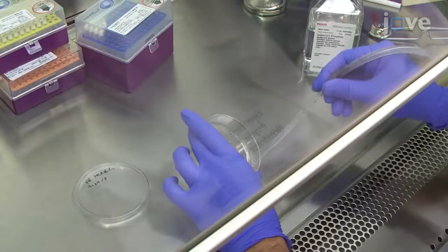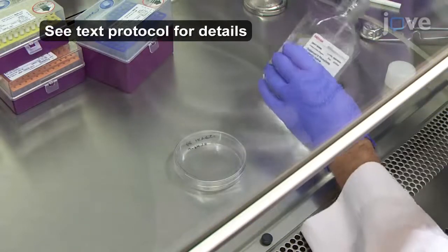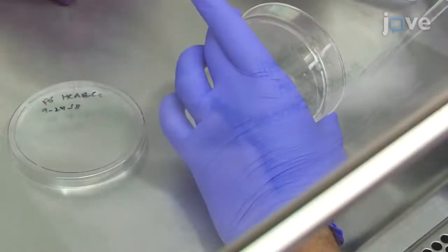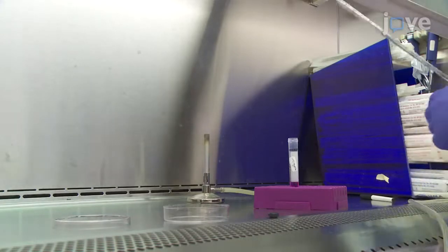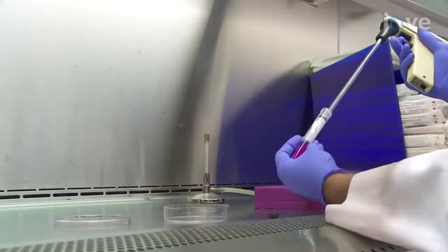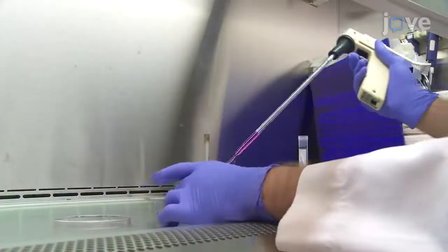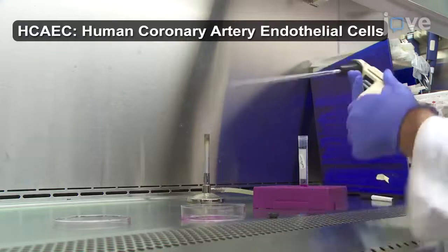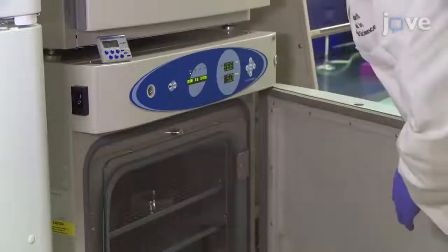To begin, aspirate the media off the previously prepared cells and wash the cells with 5 ml of Dulbecco's phosphate buffered saline. Aspirate the DPBS. Next, to detach the cells from the 100 mm dish, add 1.5 ml of 0.25% trypsin EDTA for the HepG2 cells, and add 1.5 ml of 0.05% trypsin EDTA solution for the HK2 cells or the HCAECs. Incubate the plates at 37 degrees Celsius for 4 minutes.